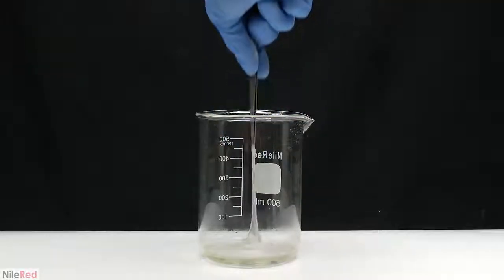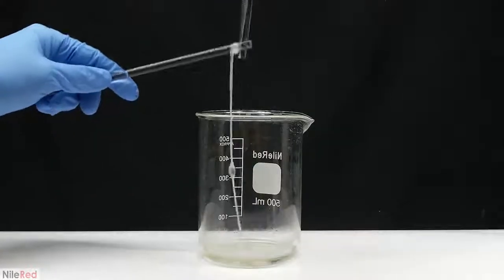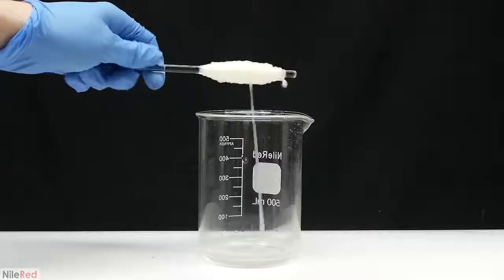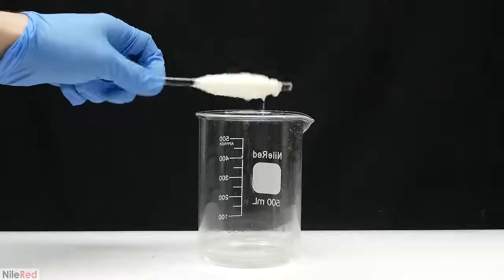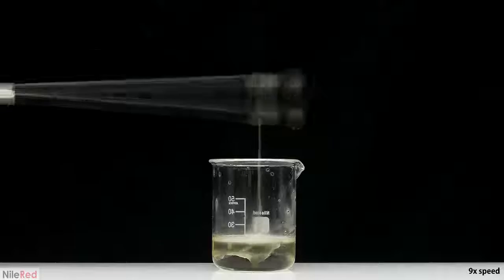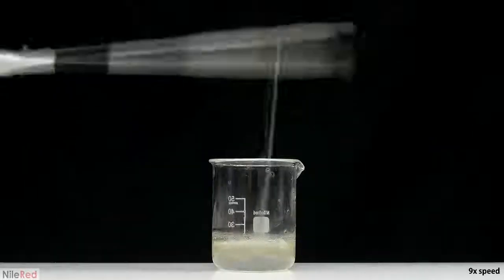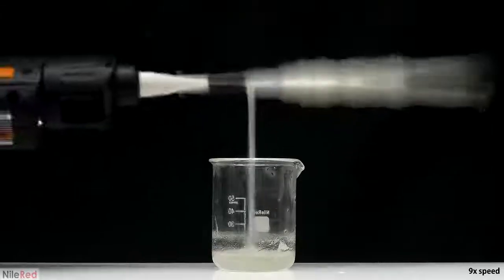I tried it again using the same amount of each ingredient, but this time in a much larger beaker. It ended up being pretty much the same thing, and the only difference was that it was a little bit faster. There's a larger surface area between the two layers, so we pull more nylon with each turn. It was a little bit tedious doing all this turning, so I tried to make things a little bit more automated. A glass stir rod was taped to an electric drill, so this time I just need to click a button to pull out the nylon.